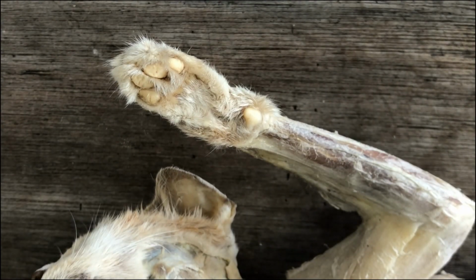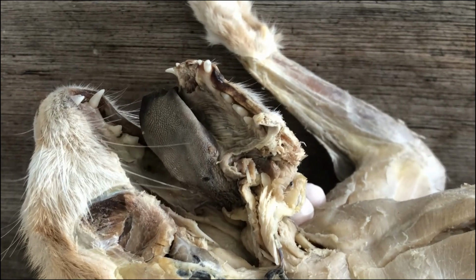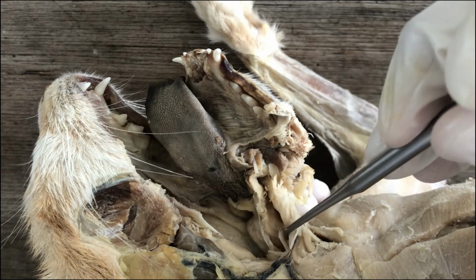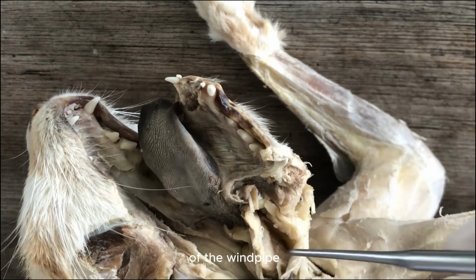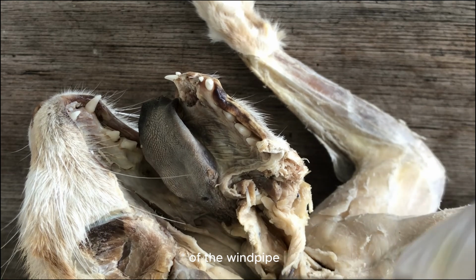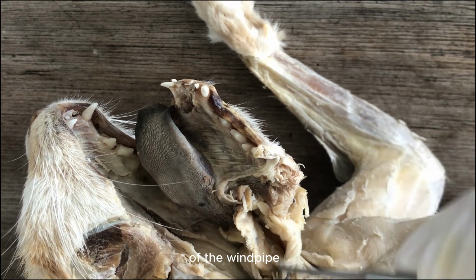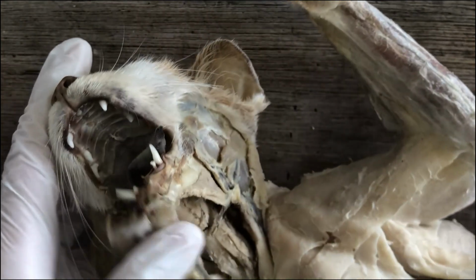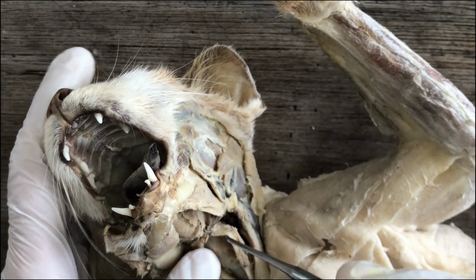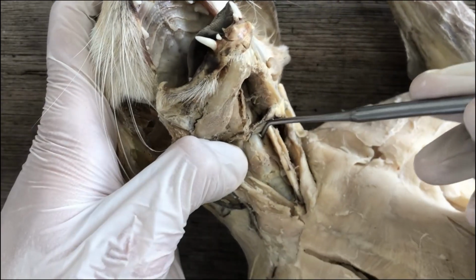Right. Now we examine the larynx. The larynx is just the anterior portion of the respiratory tract that is surrounded by cartilages. Okay, so this region here is the beginning of the respiratory tract, and it's surrounded by cartilages. The first cartilage you have already met during our study of the neck and throat muscles.